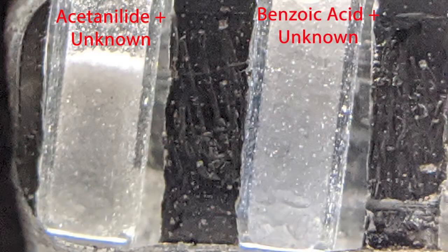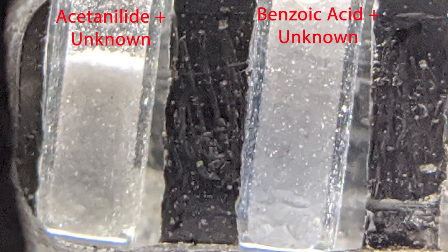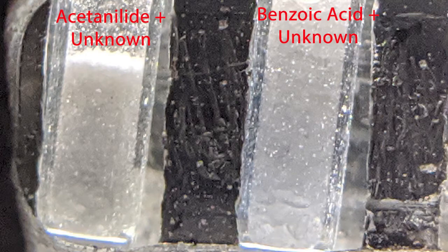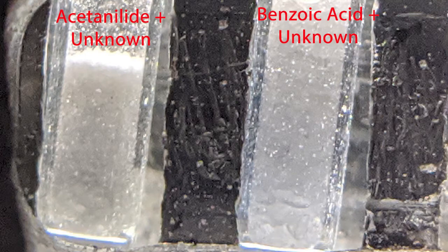Now place both capillary tubes into a melt temp to determine the melting range of each. Record the temperature at which each mixture begins to melt and the temperature at which each mixture has completed melting.